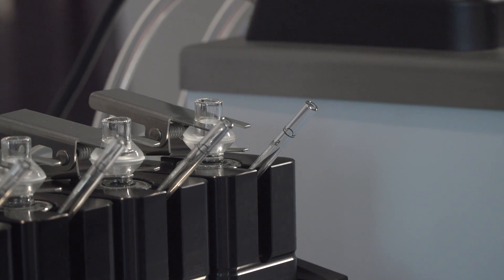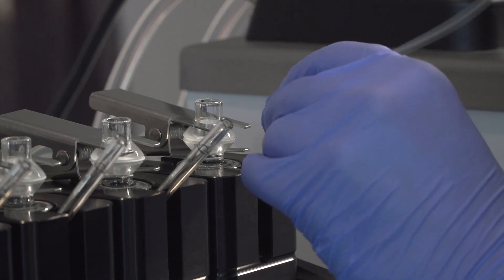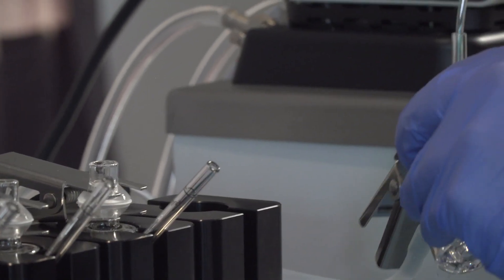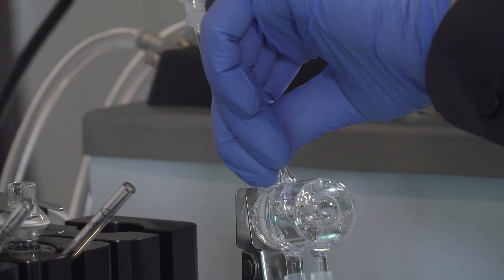To fill the cell, use a thin tube or cannula and fill the cell through the arm. Tip the cell as needed to remove any bubbles from below the membrane. If the bubbles stick in the arm, use the cannula to gently drive them out.